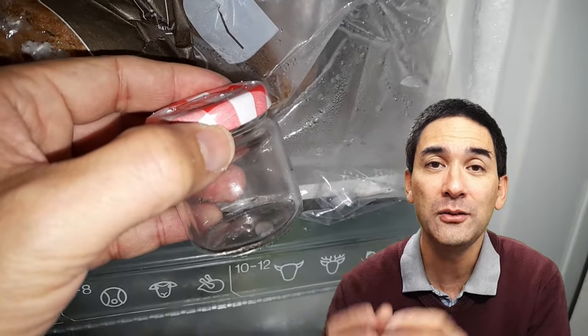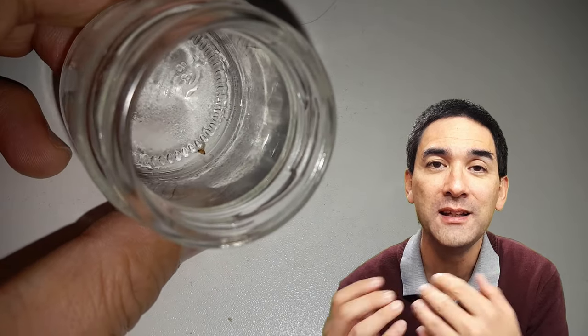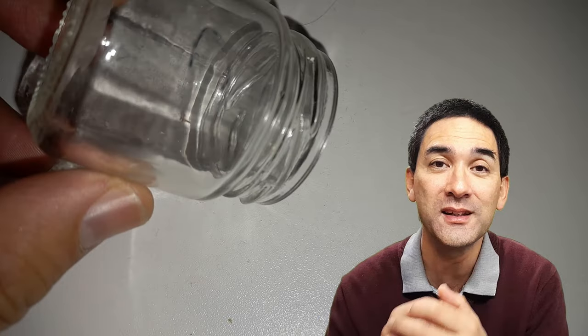I caught a fly and you have to put the fly into the freezer for a few minutes and this causes it to stop moving and that's how you're able to actually then transfer the fly to the spider's web on the microscope slide. You just have a few minutes to do that.